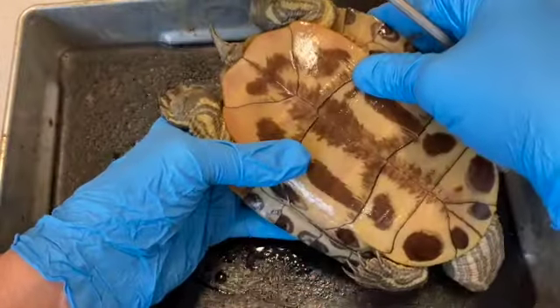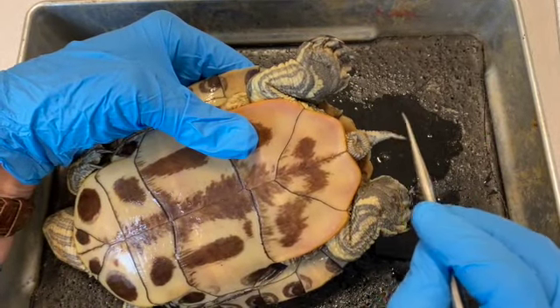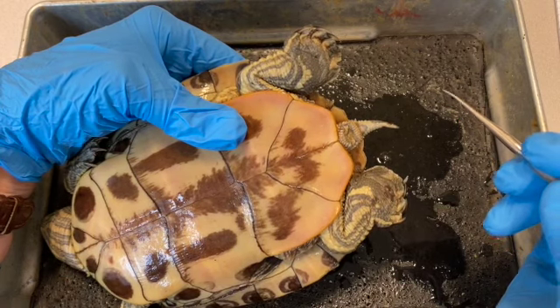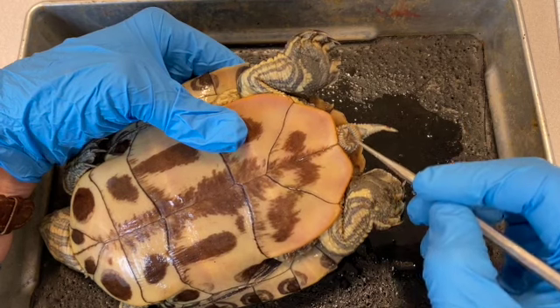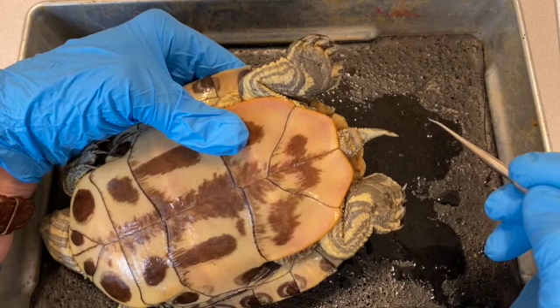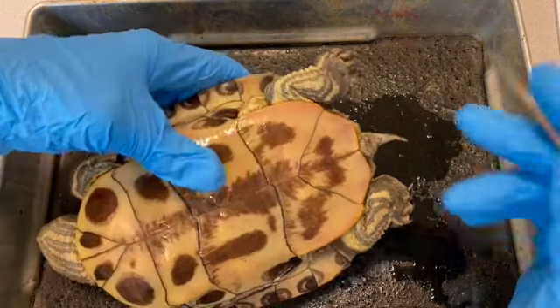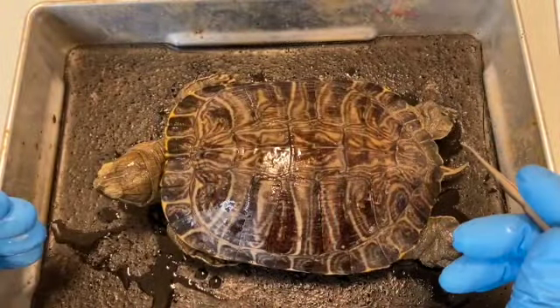The posterior end of the animal, I guess we'll just shift it this way. We have the muscular postanal tail right here, and this opening is not the anus. It's a structure called the cloaca. And a cloaca is an opening that more than one system of the body releases its material through. So this animal, through this single opening, would release its nitrogenous waste from the excretory system. It would release feces from the digestive system and reproductive material from the reproductive system. And that's a quick overview, introduction to the external anatomy of the red-eared turtle.